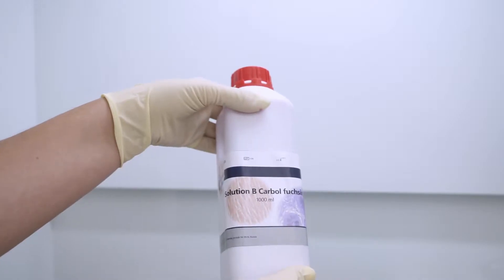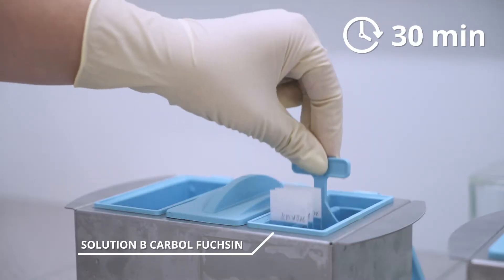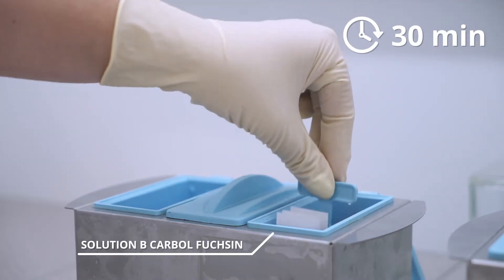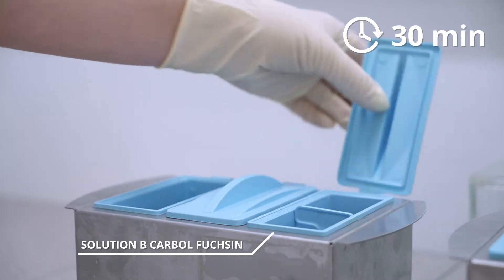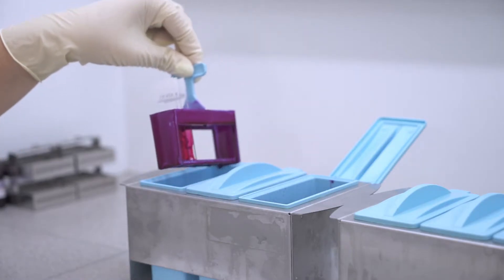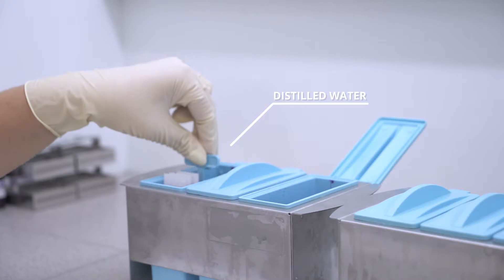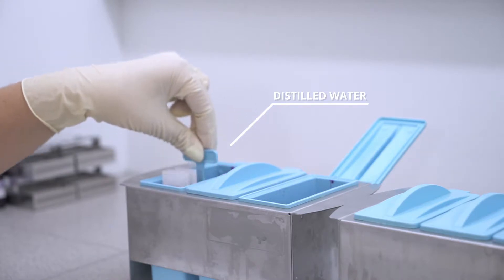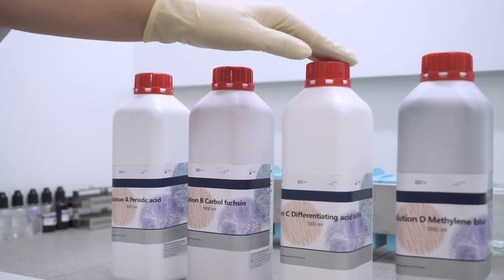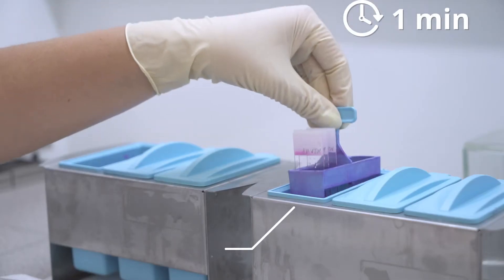Then we put slides in solution B for 30 minutes. Then we wash slides in distilled water. After that we put slides in solution C for 1 minute.